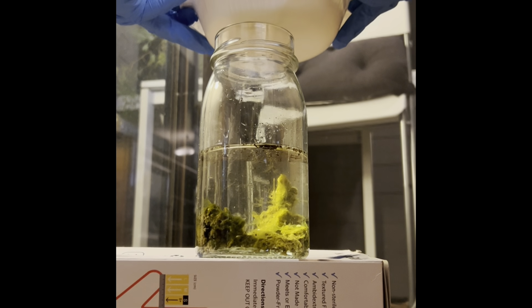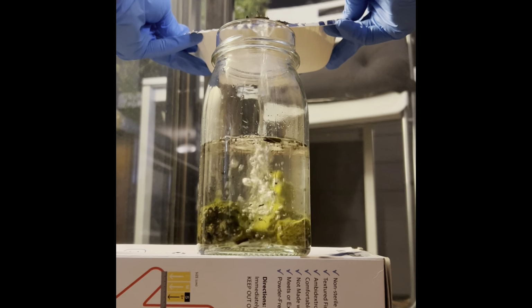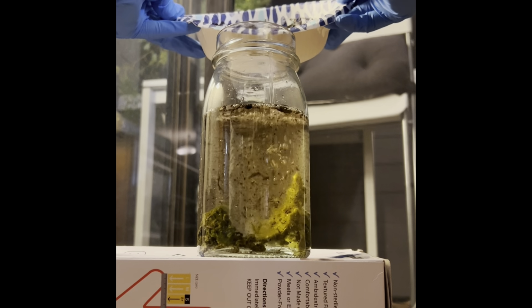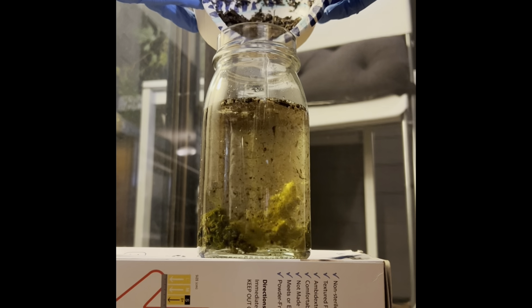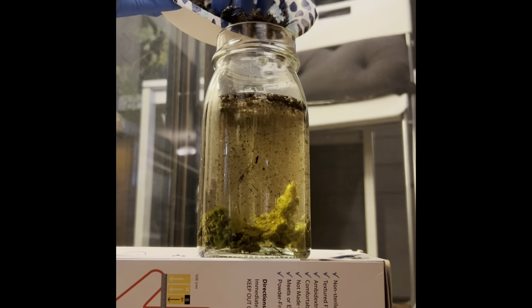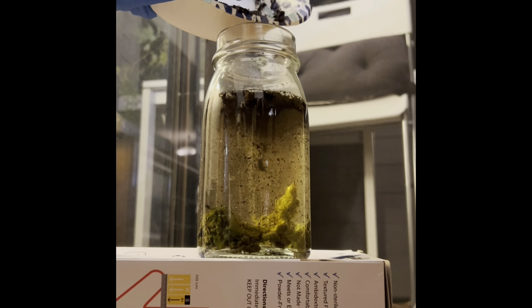After seeing that there was really no microorganisms, I decided to add some more water as well as a mud sample to the ecosphere, hopefully to stimulate some microorganisms if there were any actually in the ecosphere. Right here, I'm in the process of adding it. This was halfway through the week, and I wondered if doing so would actually alter what I would end up seeing within the ecosphere.